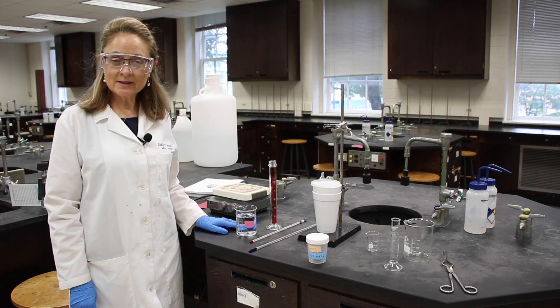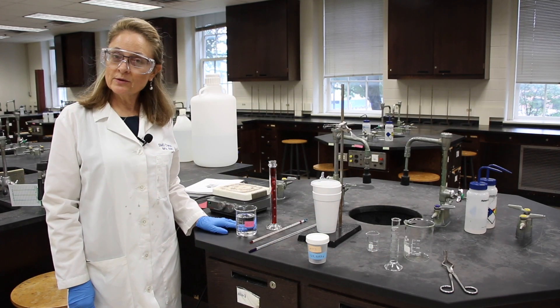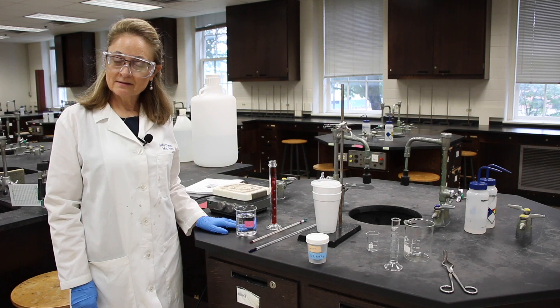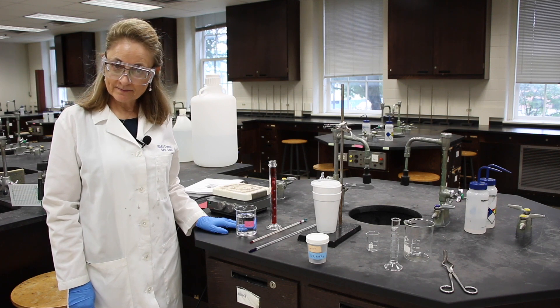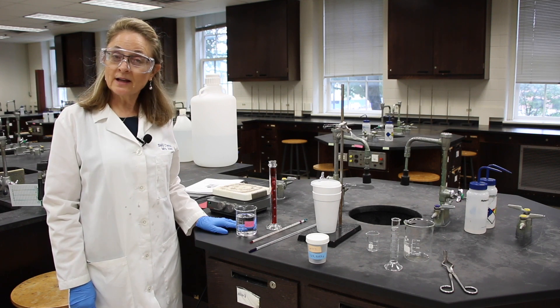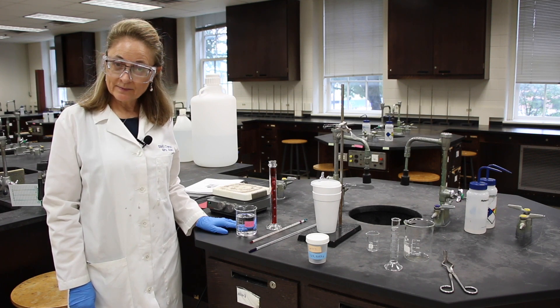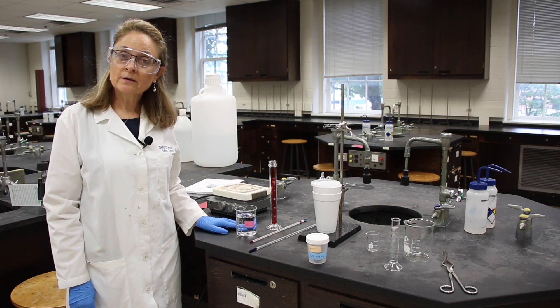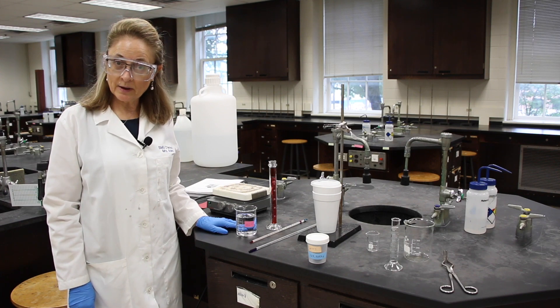Hello and welcome to lab. Today we're going to do Experiment 8, Heats of Reaction. I'd like you to be my lab partner. Please follow along with the instructions in the lab manual.